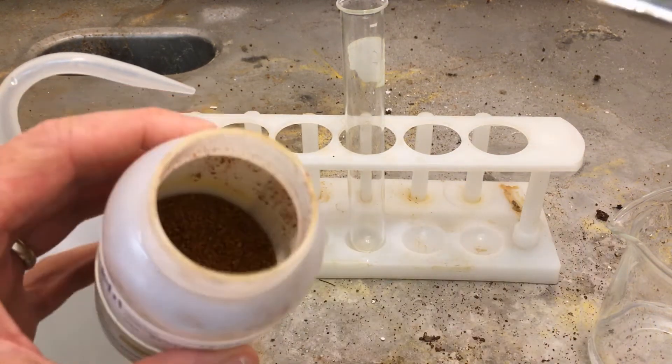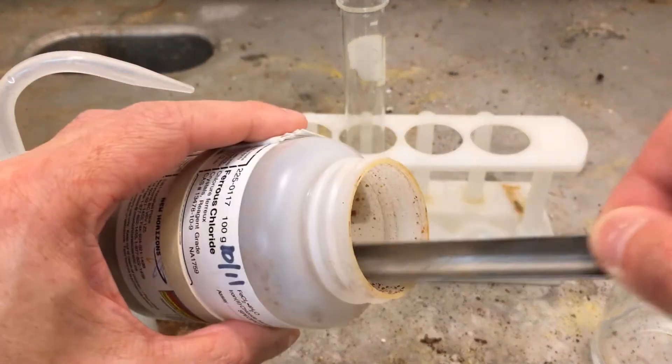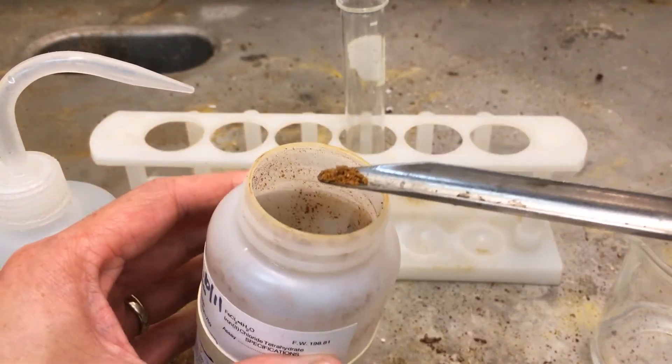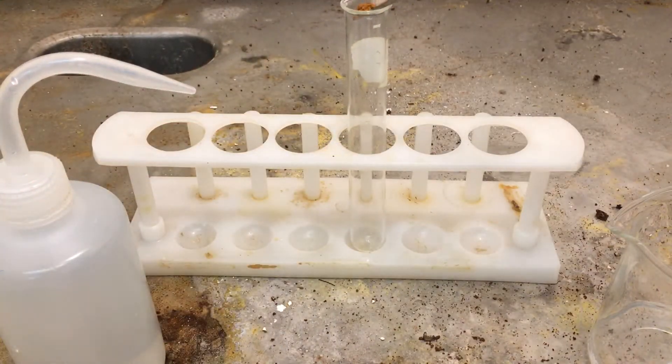Let me demonstrate that for you. This is iron 2 chloride. I'm just going to scoop a little bit of this—I don't need a whole lot—into this test tube.